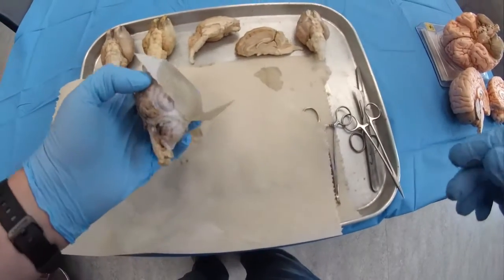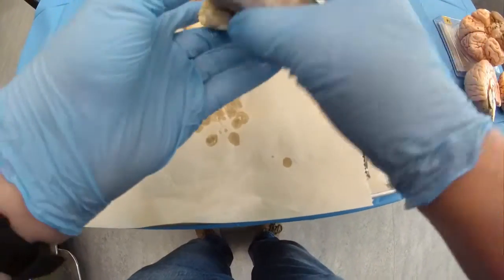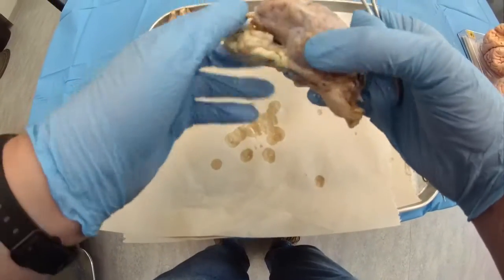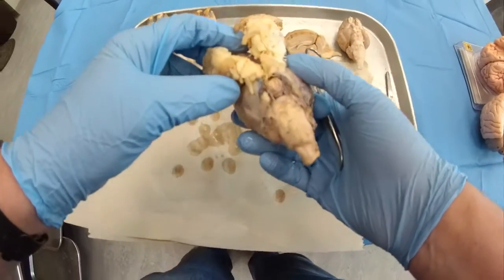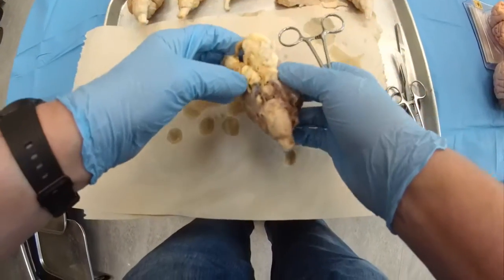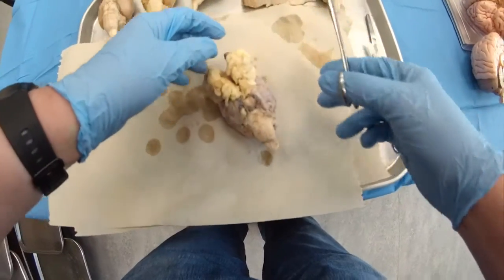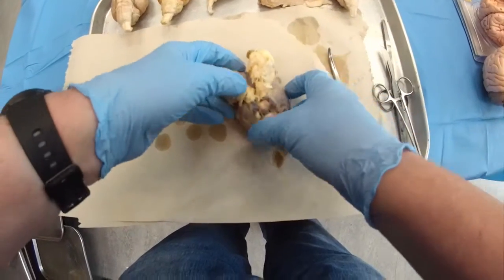Okay, this is the sheep brain. This is the way we receive this specimen, and you can see that it's covered with dura mater. At the base of the sheep brain there are some little pieces of fat, so-called fatty cushions. They are extending into the orbit, and this is the structure that actually makes the eyeballs better situated in the orbit.